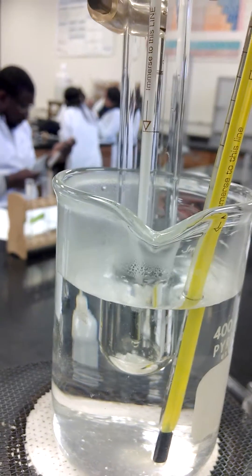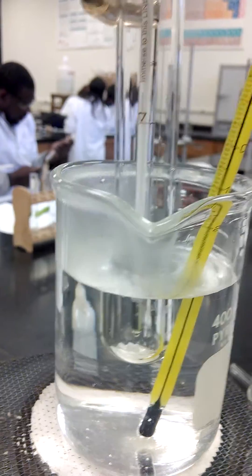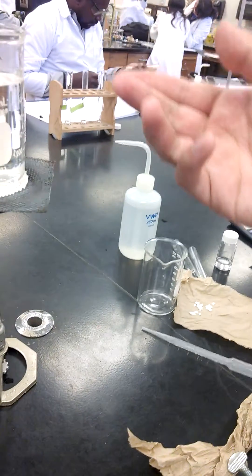So the one in there, oh it's almost boiled up, what is it at? 57, so it stays at 57. So see, this is at a higher temperature.